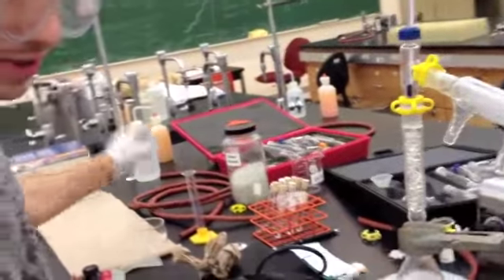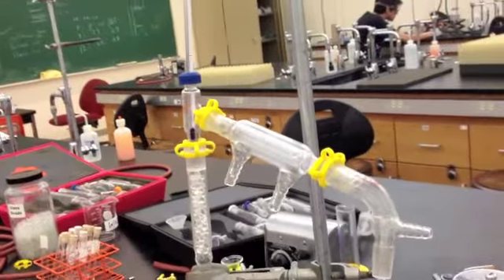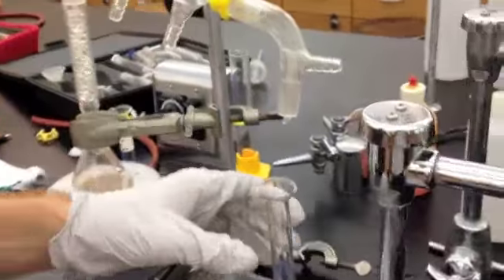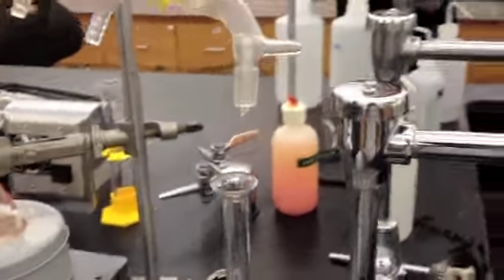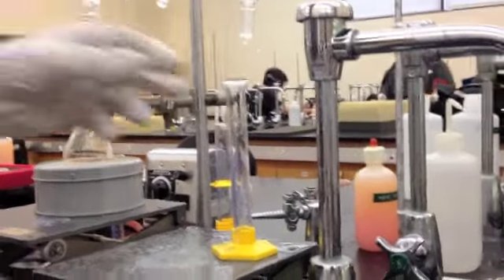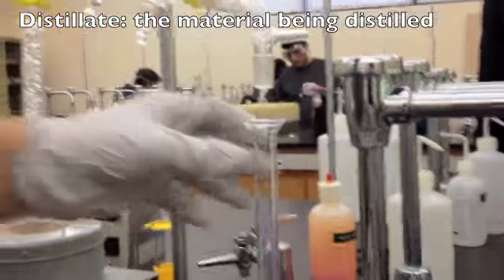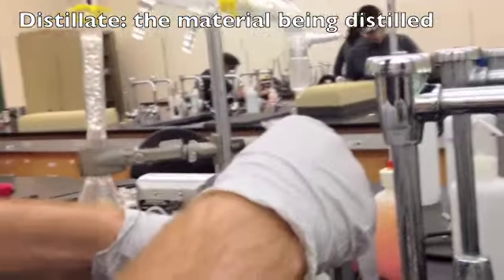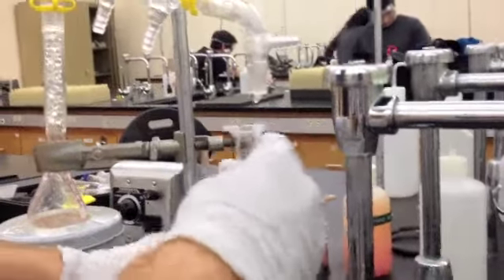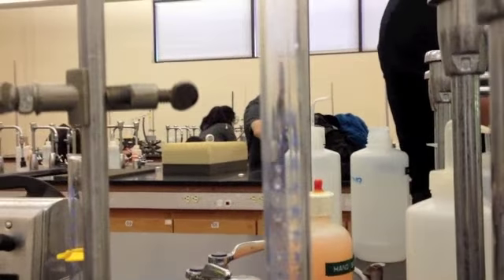Now that you've adjusted the glassware, you can add a graduated cylinder for the distillation. When you're running a distillation, the distillate will come through the vacuum adapter and into the graduated cylinder, where you can see in one milliliter increments or half a milliliter increments, depending on what you're asked for, what the volume is, and you will check the temperature.